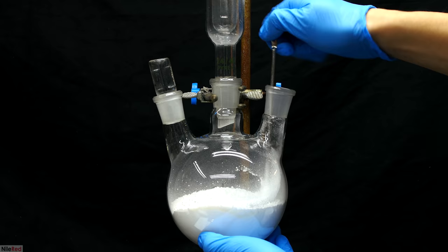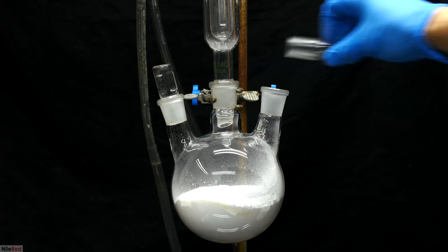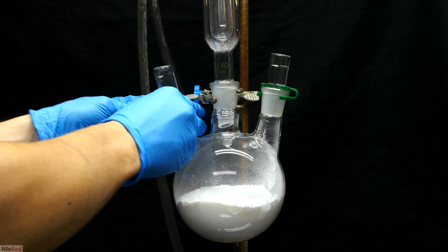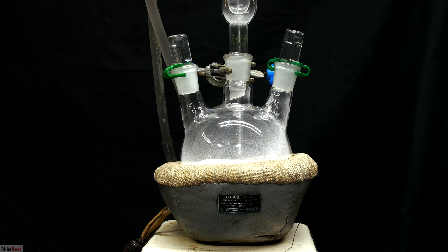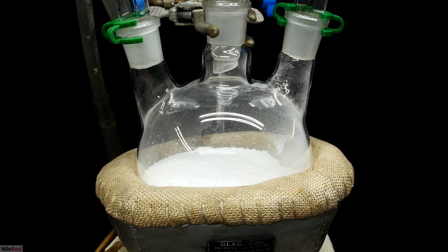The reaction worked out fine but if I were to do this again I'd definitely mix it a little better. A stir bar was added to the flask and then I sealed the opening with a glass stopper. I used some plastic clips to keep the stoppers in place and then using a lab jack I positioned a heating mantle below the flask. Here's a shot of the entire apparatus and it's not very complicated. Above the flask all I have is a condenser column which is being cooled with cold water.